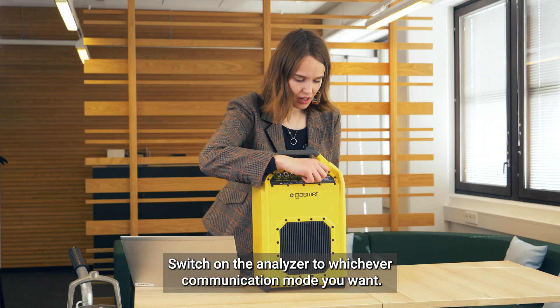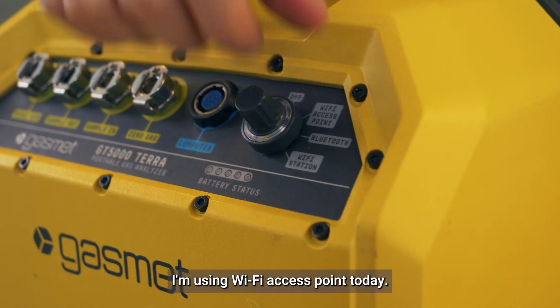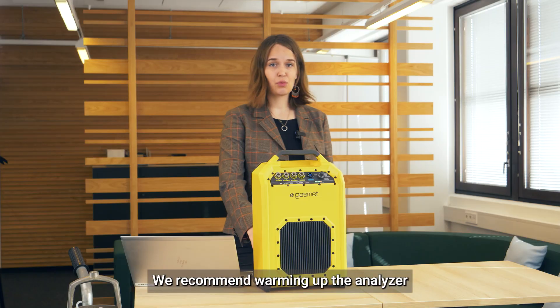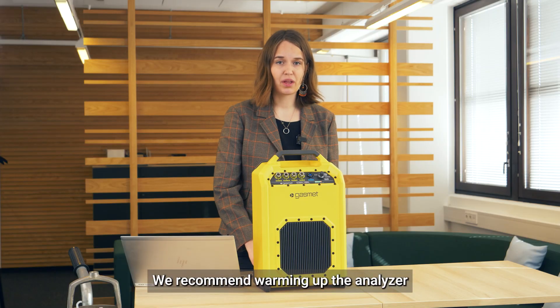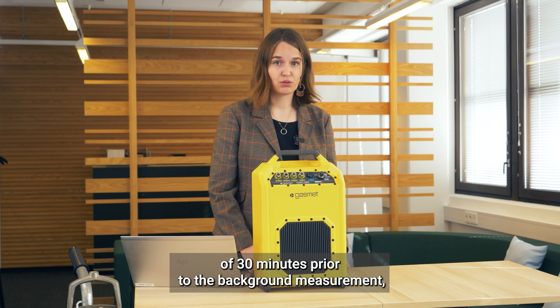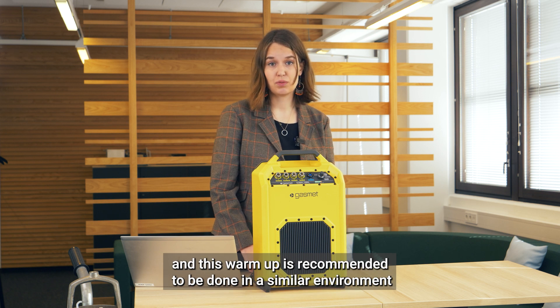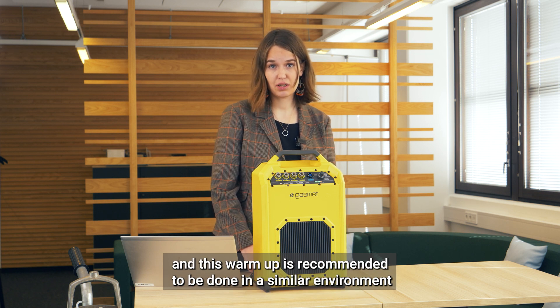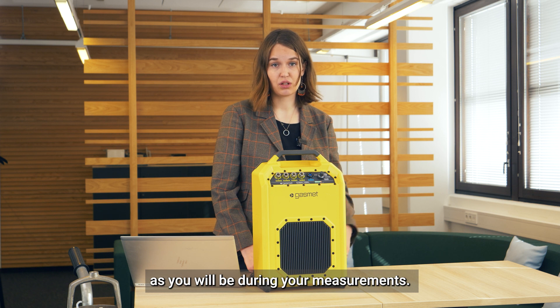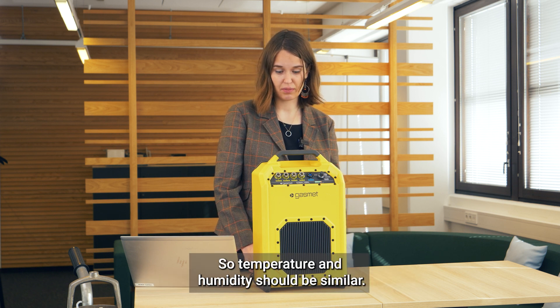Switch on the analyzer to whichever communication mode you want — I'm using Wi-Fi access point today. We recommend warming up the analyzer 30 minutes prior to the background measurement. This warm-up should be done in a similar environment as you will be doing your measurements in, so temperature and humidity should be similar.